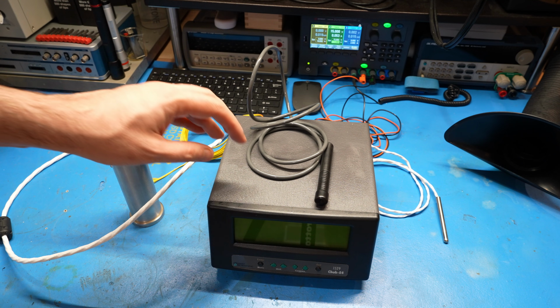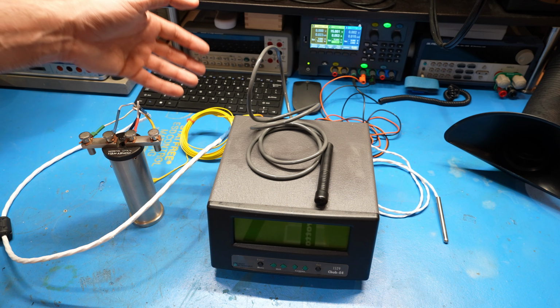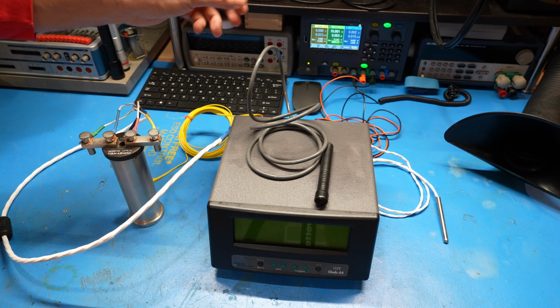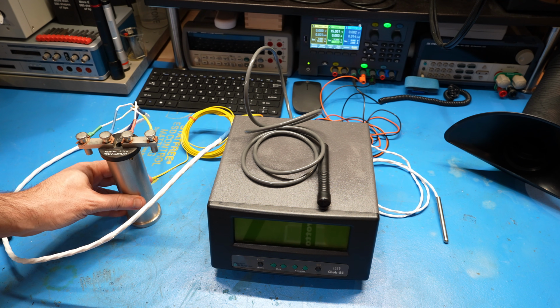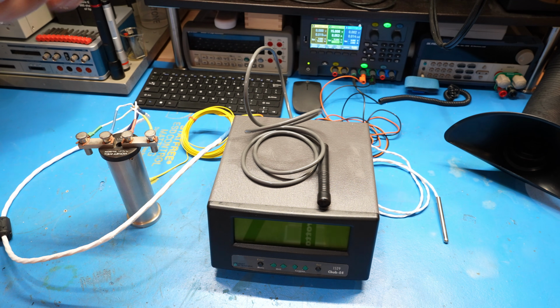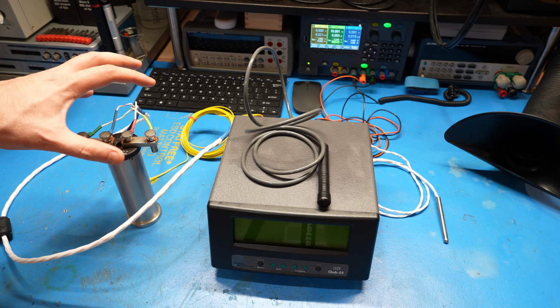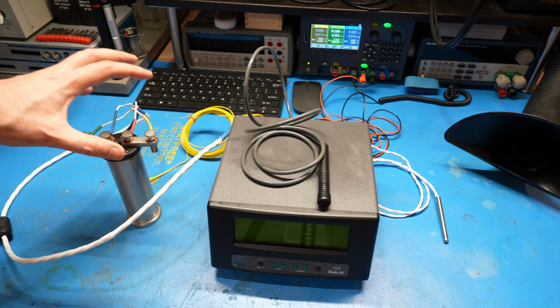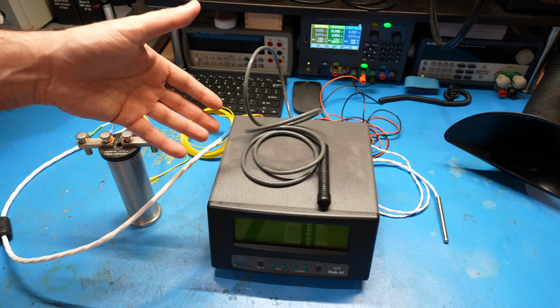All right, we have everything back together over here. I now have 2 channels of PRT and 2 channels of thermocouple, and I've connected 4 things to the instrument. I have a type K thermocouple for channel 1, a type K thermocouple for channel 2, a precision oil-submerged 100 ohm resistor connected to channel 3, and an actual PT100 type PRT for channel 4. For a PT100 type at exactly 100 ohms, you should have a reference of exactly 0 degrees Celsius. And since this is a precision resistor connected with 4-wire, we should be able to also see if it is measuring resistance correctly.